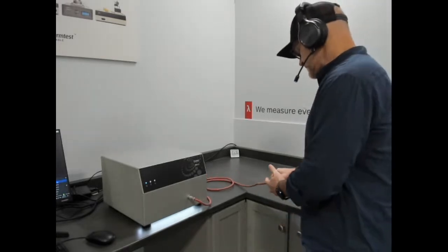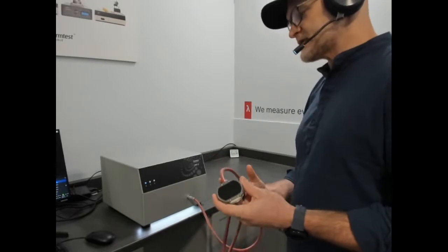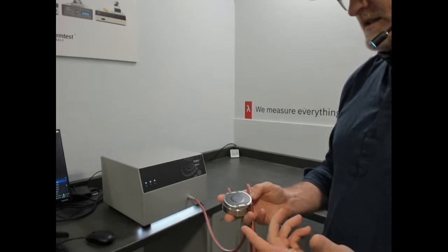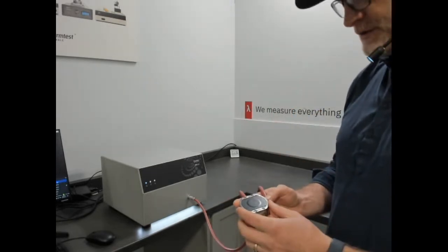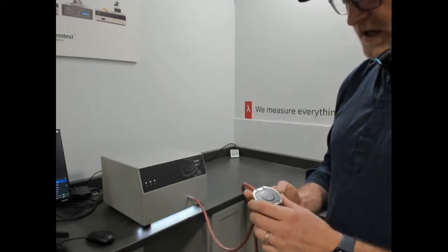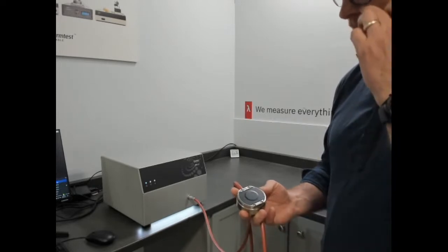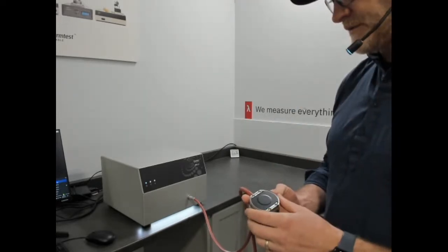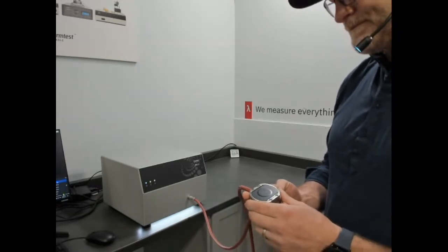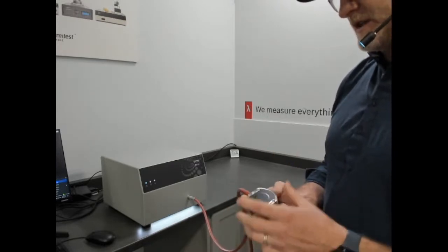So today we're going to talk a little bit more about the MTPS sensor and how it relates to standard measurements, as well as the new ISO. By new, I mean 2022, so that's fairly new. The ISO 22007-7, which describes the direct measurement of thermal effusivity, and I'll talk a little bit about that, for one-dimensional shape, and what the standard refers to as embedded thermal effusivity, and I'll talk about those.